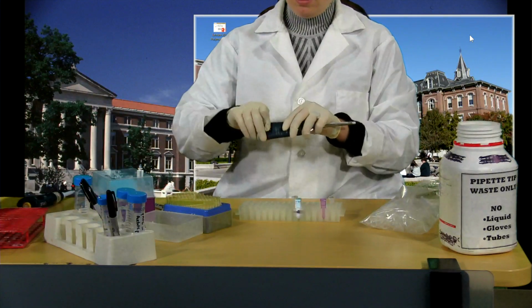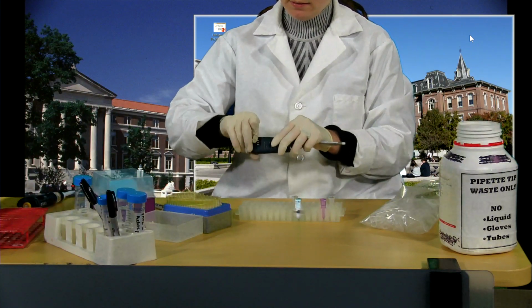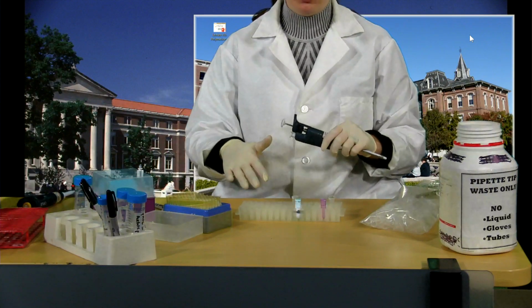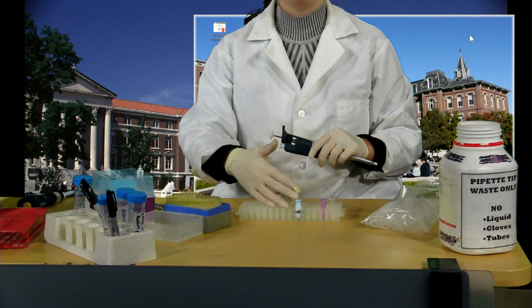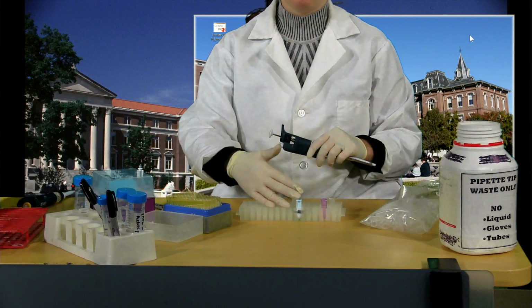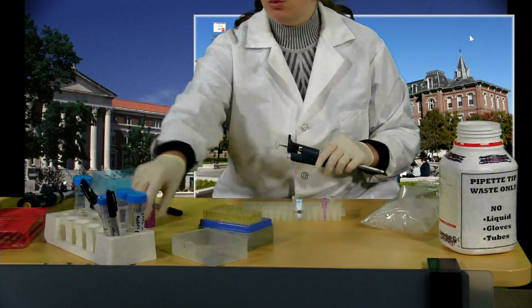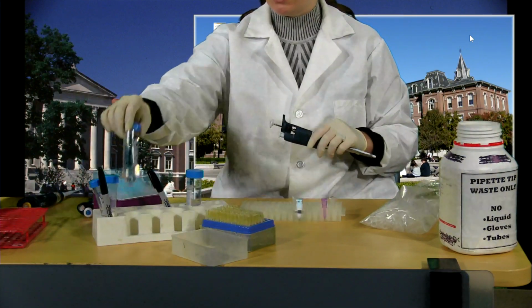Now I need to add 180 microliters of diluent, so for that I'm going to use my P200. The diluent that you use will depend on what your fractions are made up in. You should use a buffer that's going to be most similar to what your fractions have been made up in. So depending on if it is an ammonium sulfate precipitation that was carried out, or if it was a homogenization buffer or a gel filtration buffer, that's the buffer that you should use for your dilutions. Now in your exam, you will be provided with the appropriate buffers, but make sure that you spend a little bit of time thinking about why you're using particular buffers.